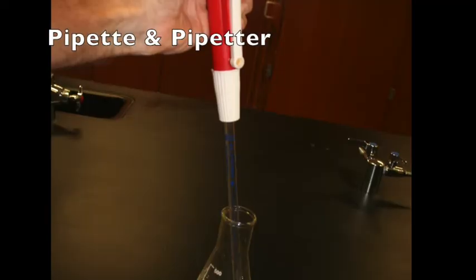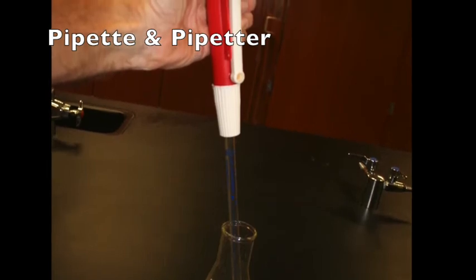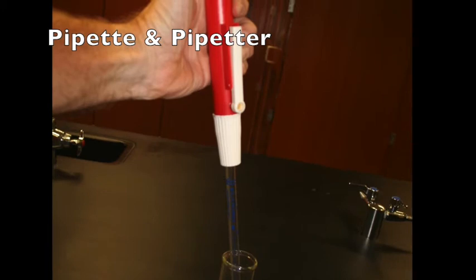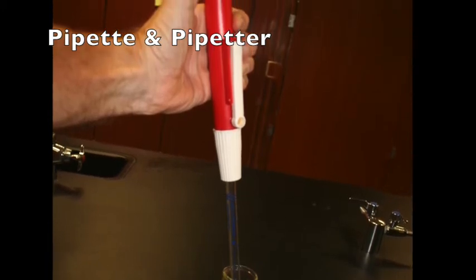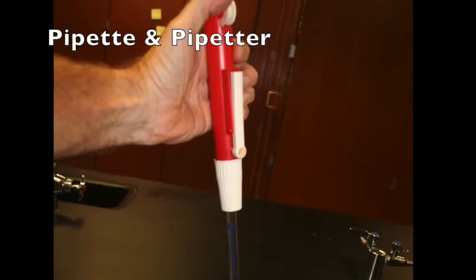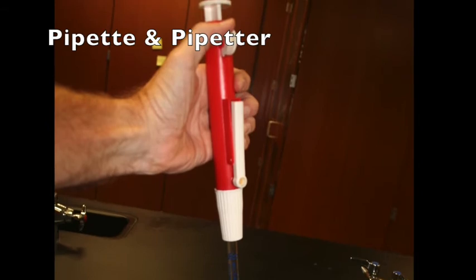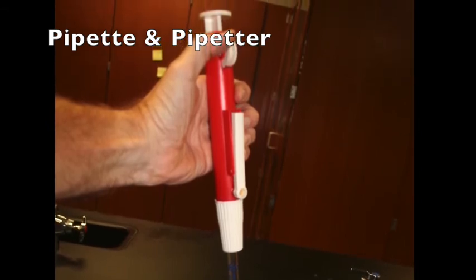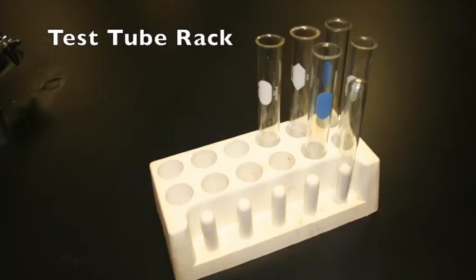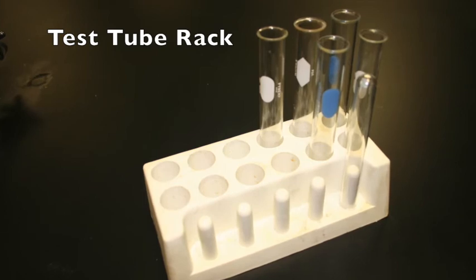The pipette is a glass tube that can accurately measure small volumes of liquid. It is used in conjunction with the device known as a pipetter, which is designed to rapidly draw and release the liquid in the pipette. The white wheel on the side of the pipetter is turned up in order to draw in the liquid and spun down to expel it. The plunger at the top and the long white lever on the side are also used for rapid release of the liquid. The test tube rack has appropriately sized holes to hold test tubes in an upright position.